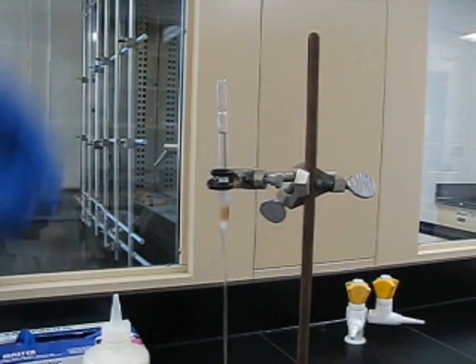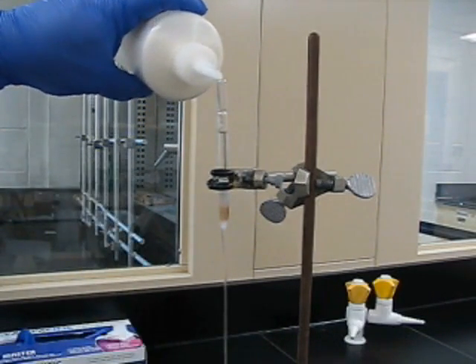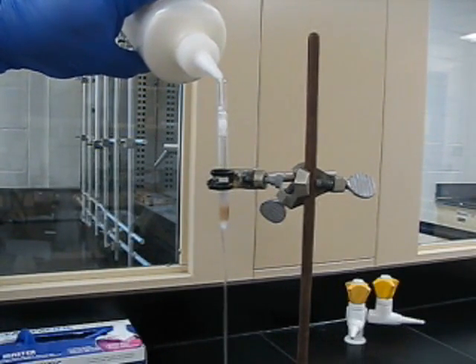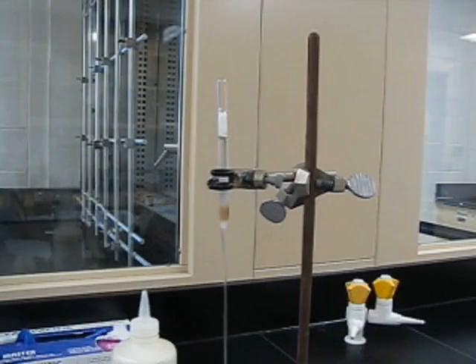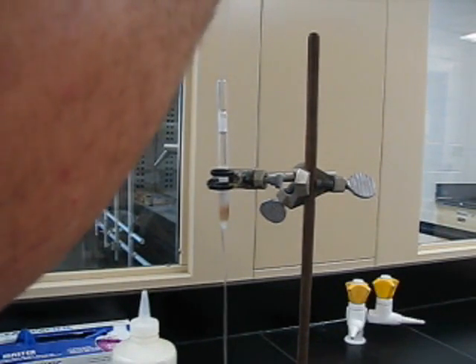Then mix it around with the pipette. Go add some more. And you're just going to keep alternating back and forth until you've got... You're probably looking at about at least two inches of silica gel in the pipette. But again, it doesn't need to be exact.